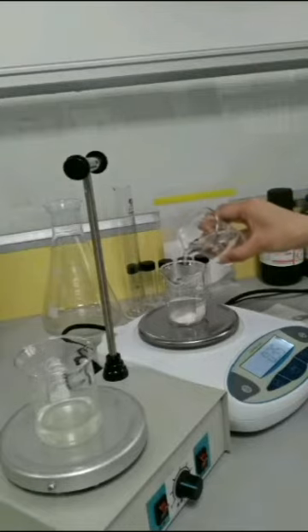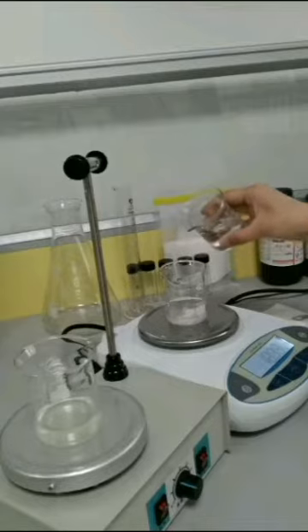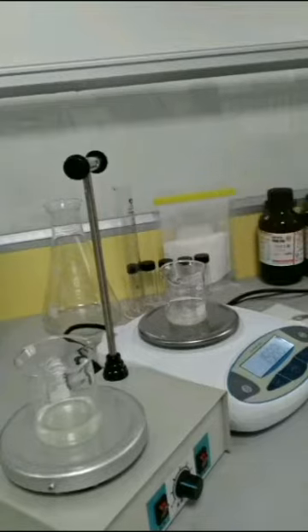And the second step is to add 15 grams of purified water. It is not recommended to use tap water. Stir the solution slightly and let it stand.